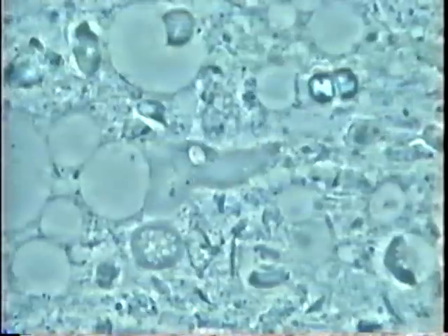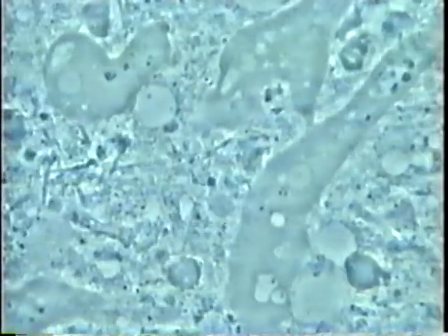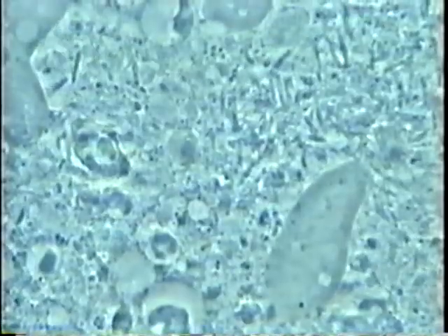Here again some white cells, some denucleated white cells, an amoeba — a small one, a large one, longer ones. All this is typical of periodontal disease.